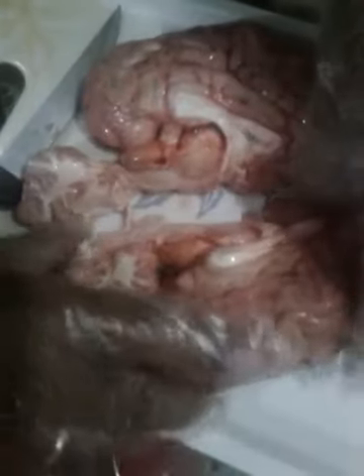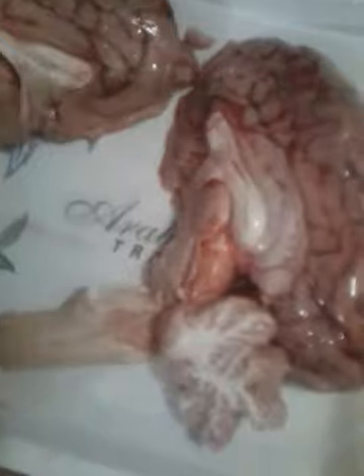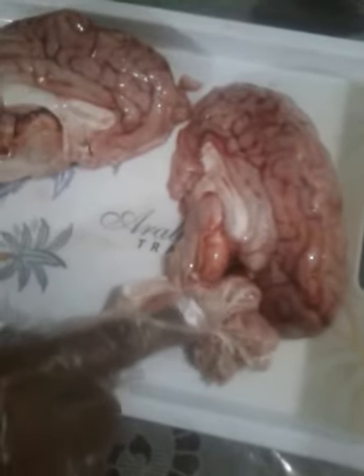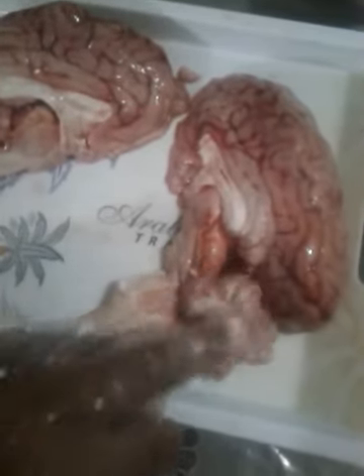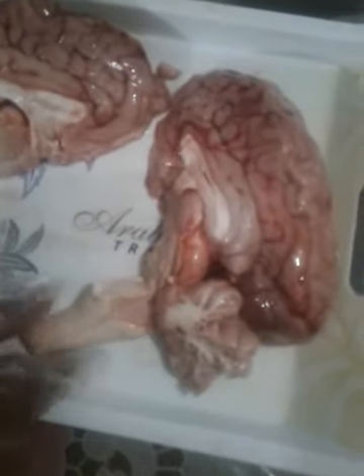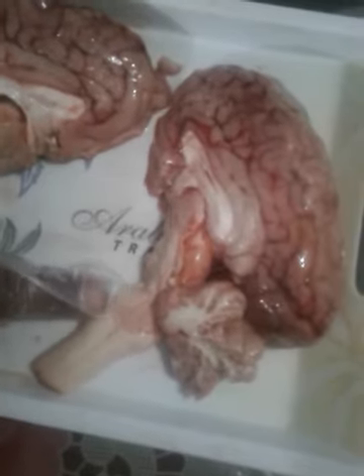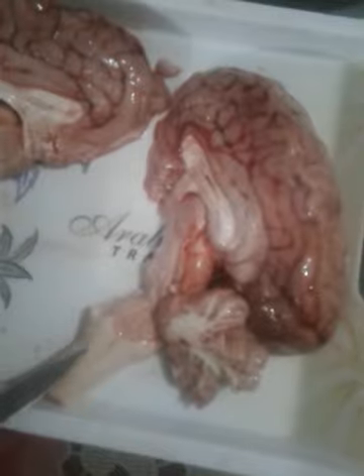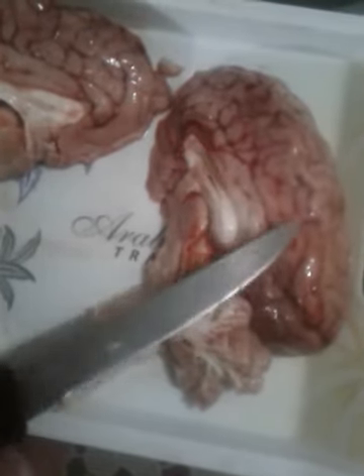In your course book, you will find the same diagram. This is a very clear portion. So you can see here, this is the cerebrum. This is cerebellum, and it's leaf-like, you will find different vein-like structures, so it's different from this one. This is cerebellum and this is cerebrum, the spellings are very close. This is the brain stem. This structure is known as pons, and after the pons you will find the medulla oblongata. This is medulla oblongata, this is pons, this is cerebellum, this is cerebrum.